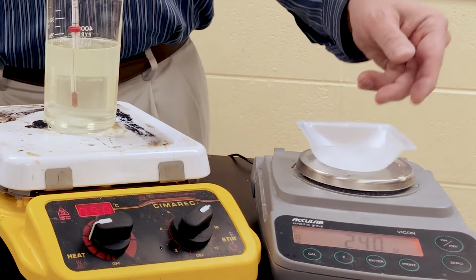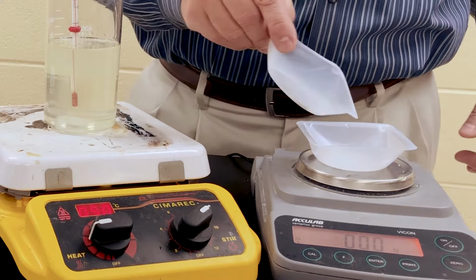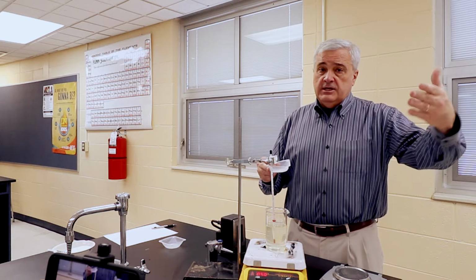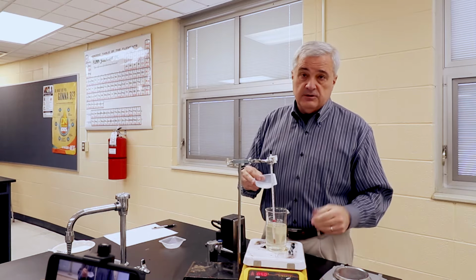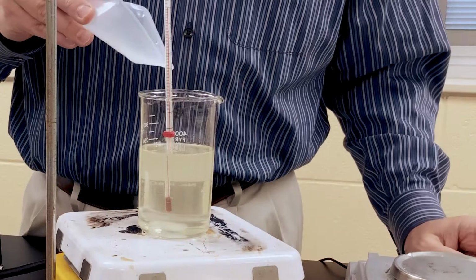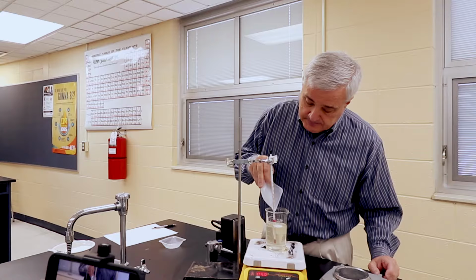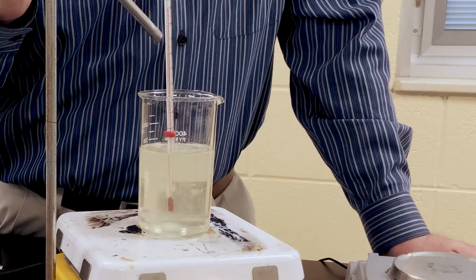We have zero the weigh boat. There's a lot of cuts in this video. In the edit, I'm going to cut a lot of this out so that you're not here as long as I've been here, which has been a very, very long time. We're going to try to add this much more. Try to agitate that surface again, get that to go down.